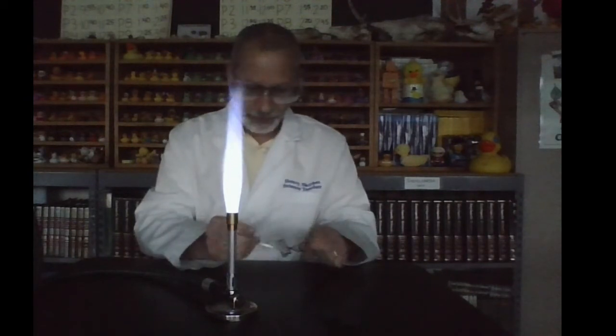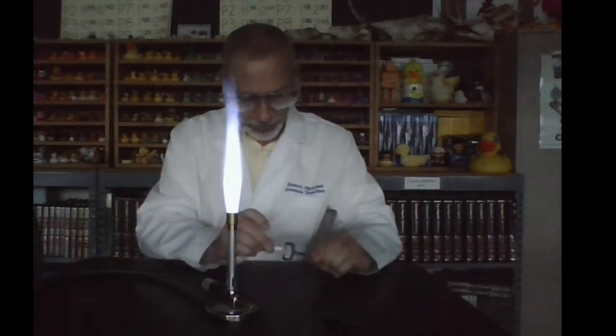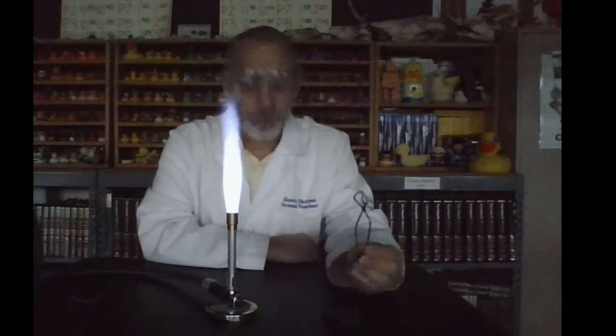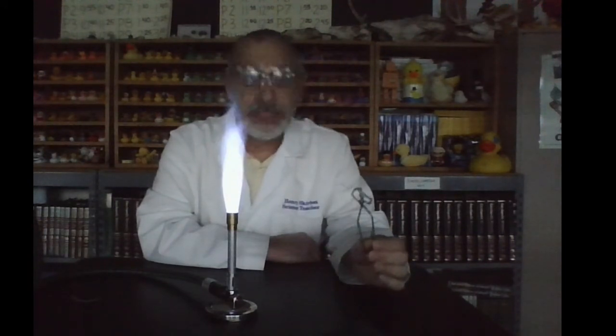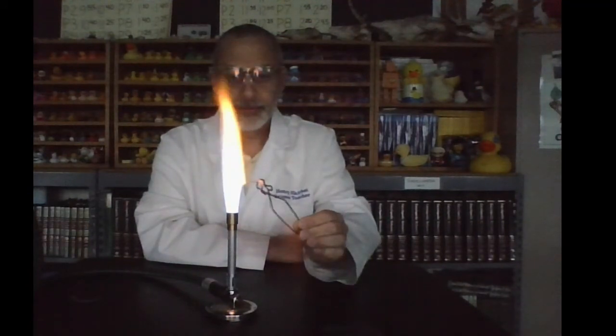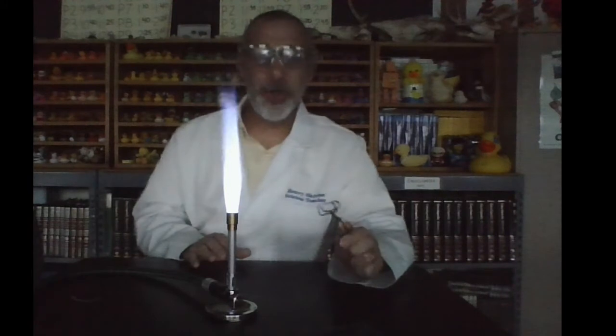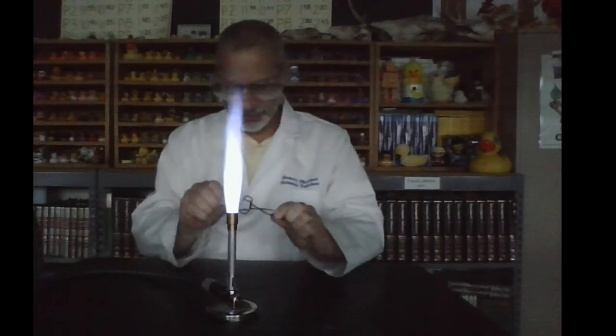And now I have the strip of magnesium ready to go. Again, I'm going to hold the tip of the magnesium into that hottest part of the flame. When I see a reaction taking place, I'm going to remove it, and I want you to note the observations. Are you ready? Here we go. Whoa! Blinded by the light! Check that out. My goodness. I have a blind spot in my eyes right now because that was overpoweringly bright. But I just so happen to have another strip of magnesium in case you missed it, because this is really fun.